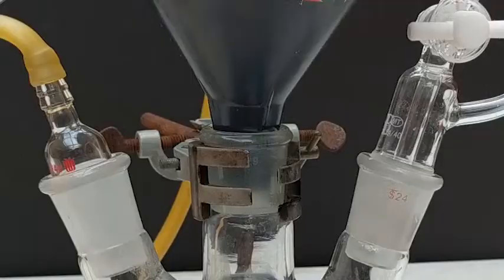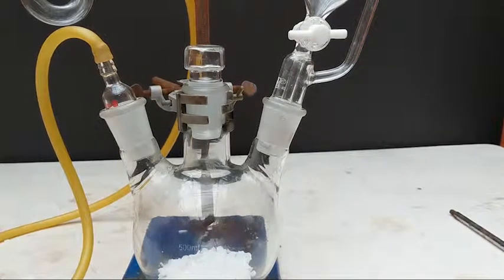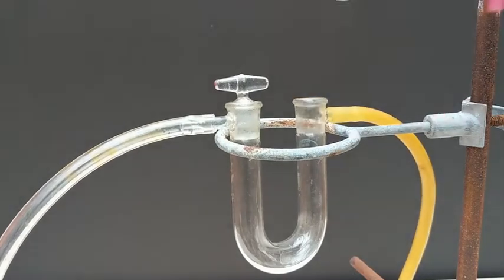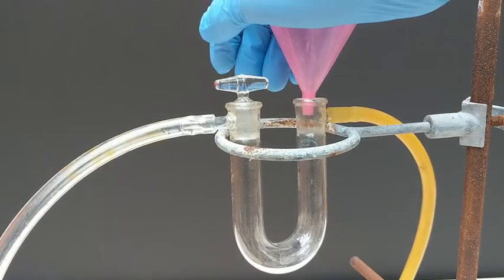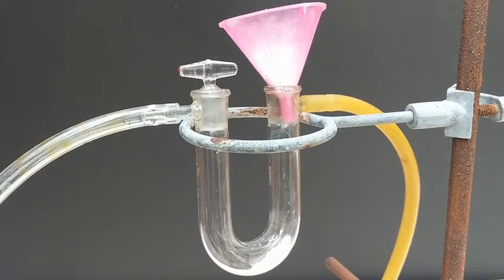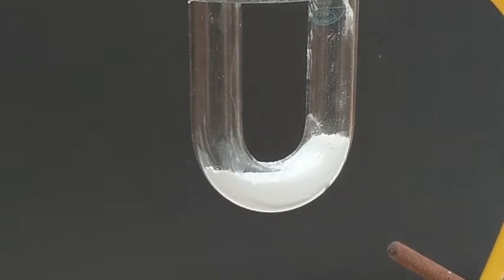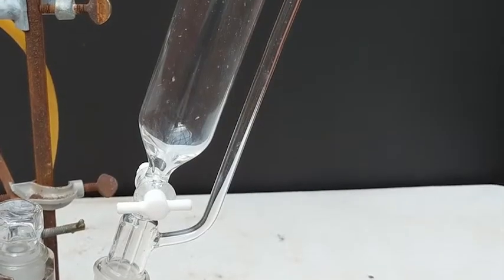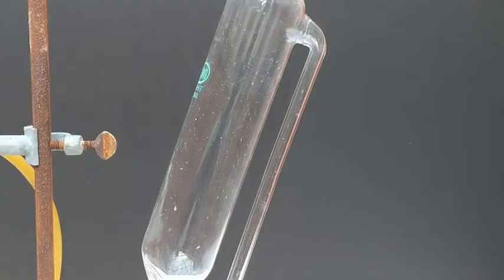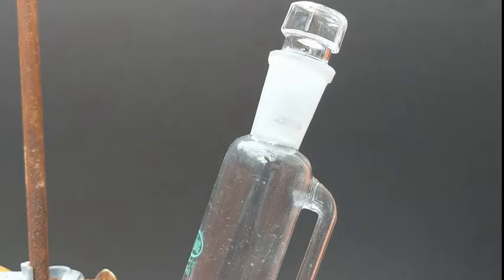Let's add in our potassium hydroxide to the reaction flask, and now the calcium oxide to the drying tube. This should absorb any water that makes it out of the flask. We want our product to be as anhydrous as possible. We decided to use an addition funnel to add the aqueous ammonia. This will allow us to easily control the rate of the reaction without letting gas escape.